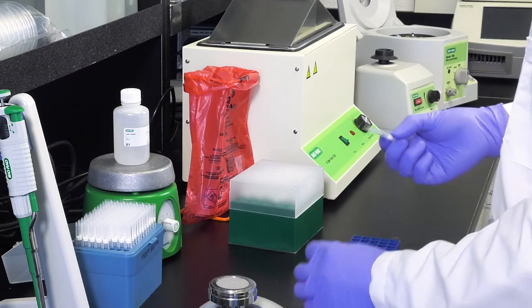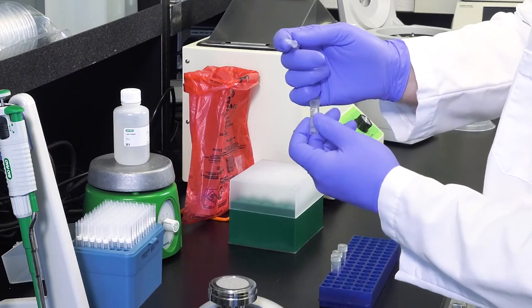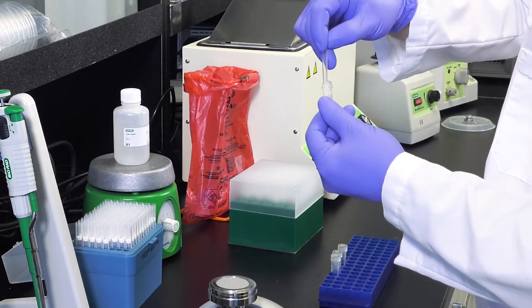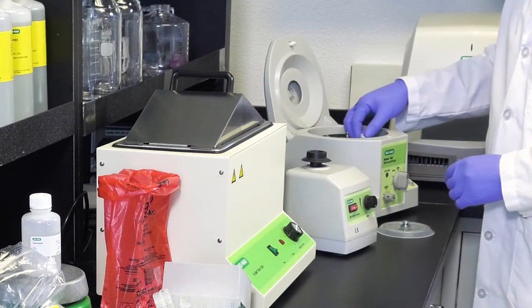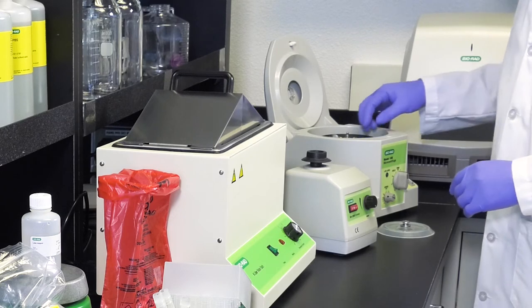Next, using a pipette tip, carefully pull out the membrane pressing it against the walls of the tube to recover all the solution. Throw away the membrane and centrifuge the tube for three minutes at 900 times G.